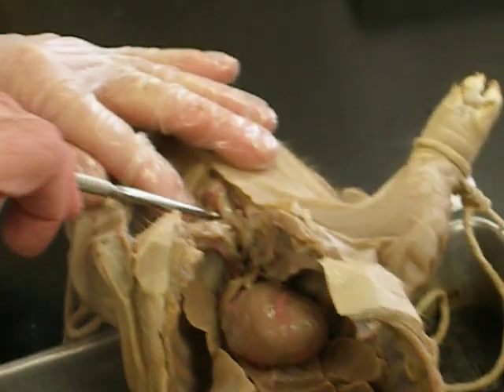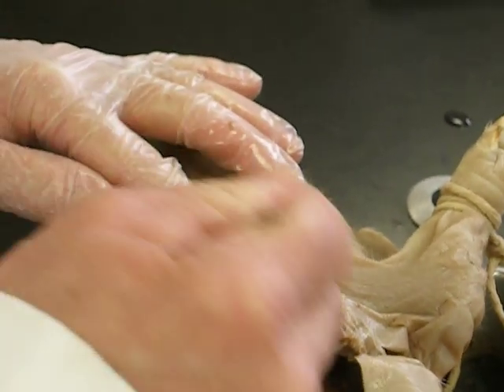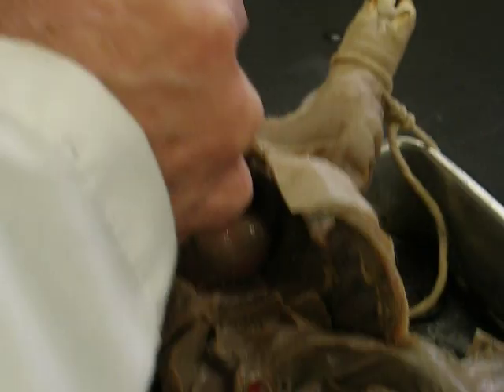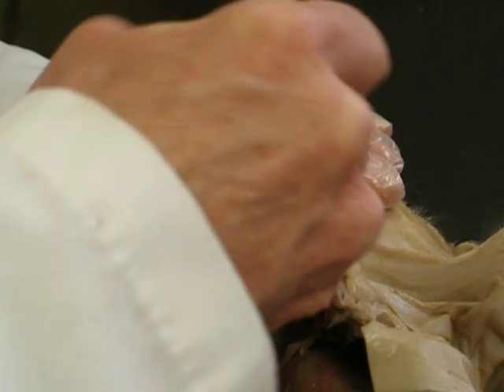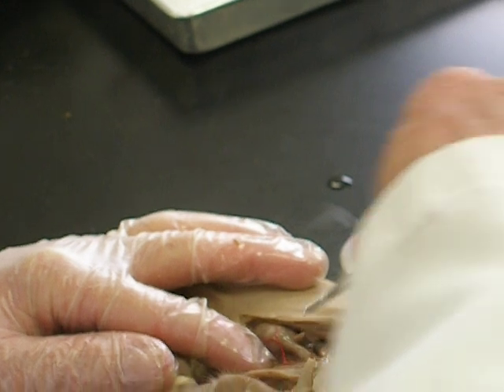And here is the larynx. The trachea. See the rings of cartilage, which help provide support for it. And underneath it — that's the windpipe, the trachea. The esophagus is underneath. This tube right here that I'm pulling up — that's the esophagus, right there. That's underneath.